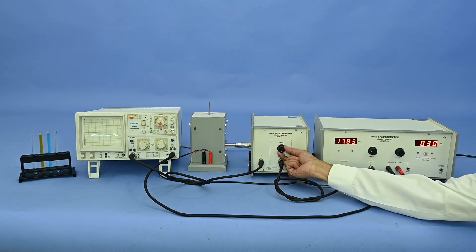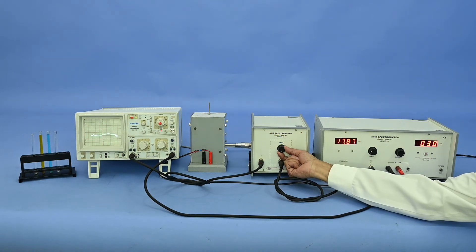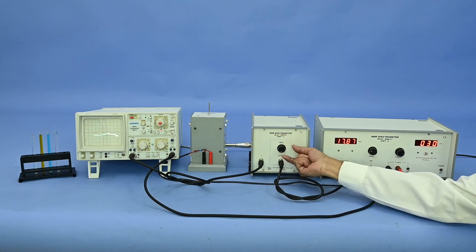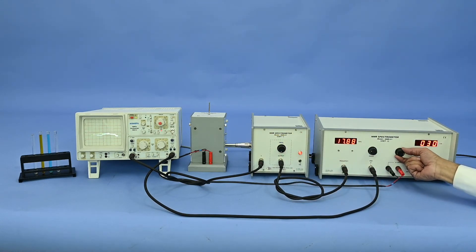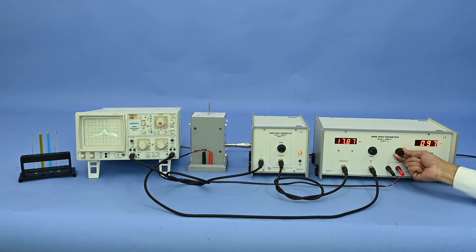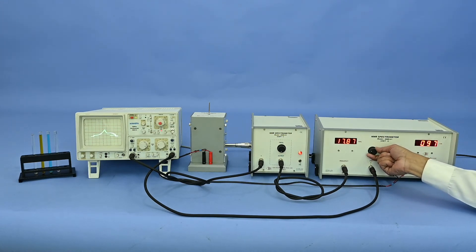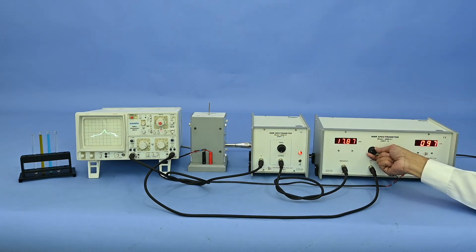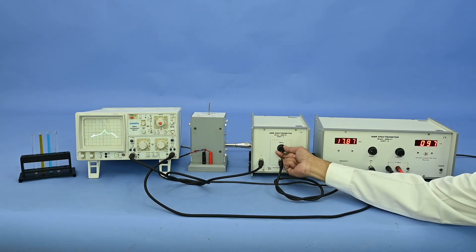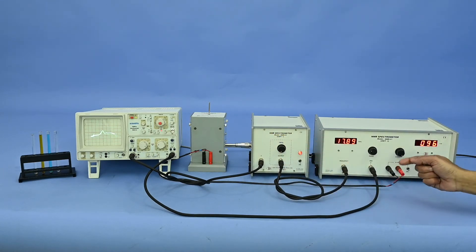Now we replace with the Teflon sample and rotate the frequency knob very gently. We get 2 peaks but they are very small in amplitude. We increase the current and get more prominent peaks, then adjust the phase. We rotate the frequency to get the position at the center, giving us the resonance frequency for Teflon.